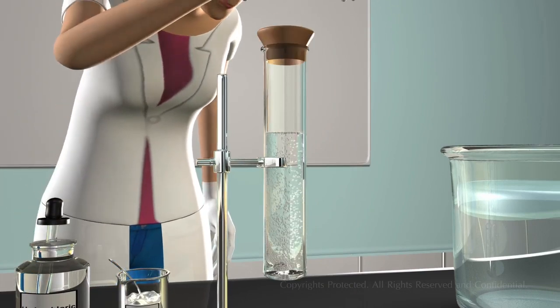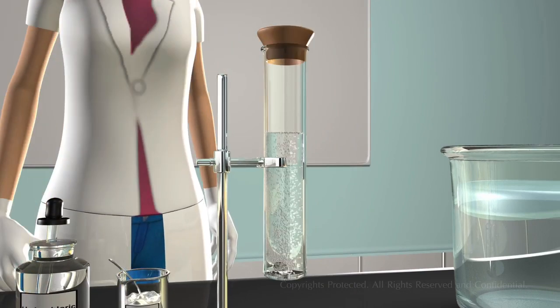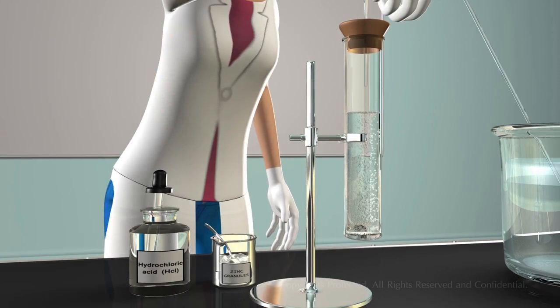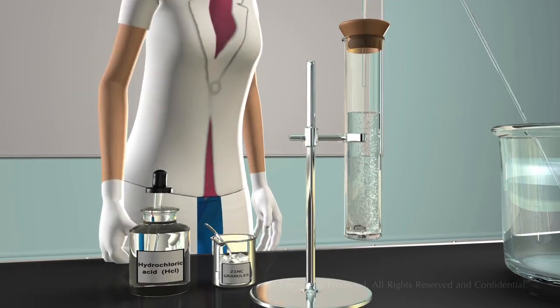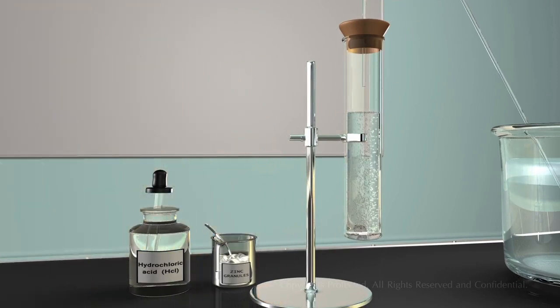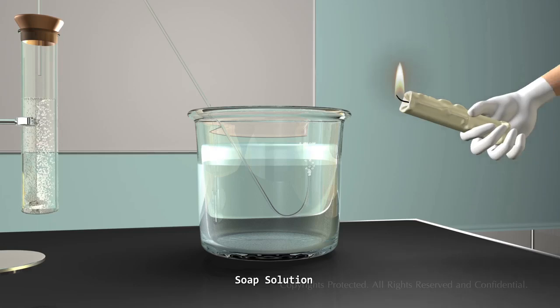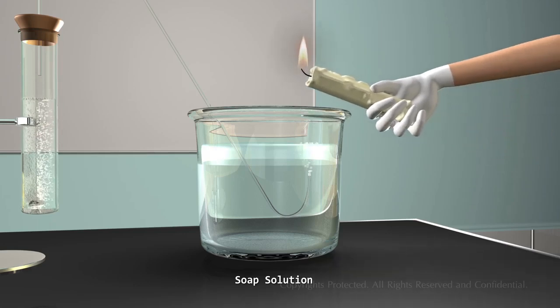You can observe some sort of salt is forming in the test tube and a certain gas is coming from the zinc granules. Now let us divert the gas to a soap solution and see what happens. You can observe that some bubble formation takes place in the soap solution. Now, take a burning candle and bring it near the gas. You can observe the gas burns with a pop sound.